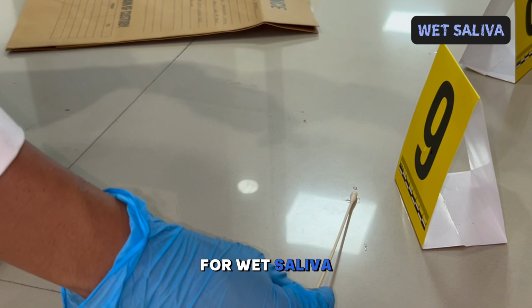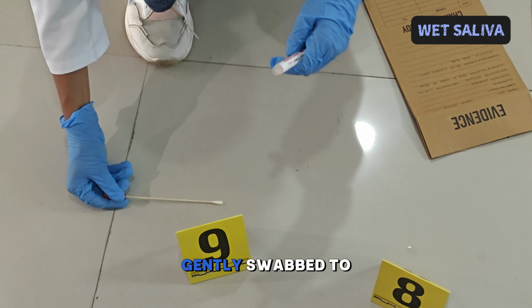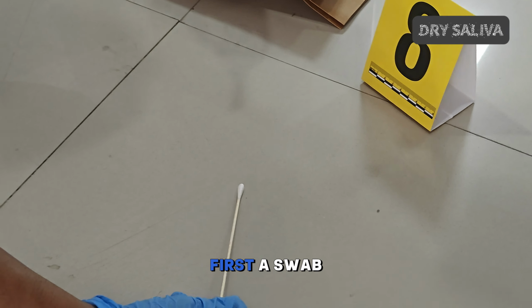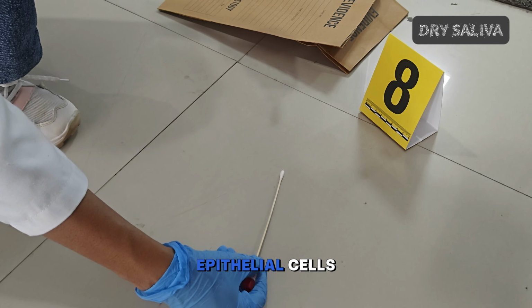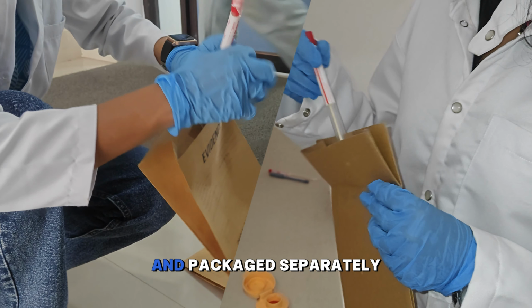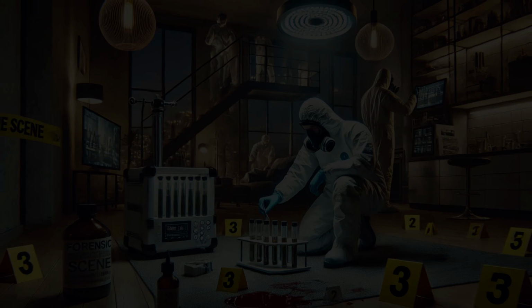For wet saliva stains, a dry sterile cotton swab is used. The area is gently swabbed to absorb the moisture. Dry saliva requires the double swab technique. First, a swab moistened with sterile water is used to loosen the dried epithelial cells, followed by a dry swab that recovers the remaining material. Both swabs are air-dried and packaged separately to maintain sample integrity.